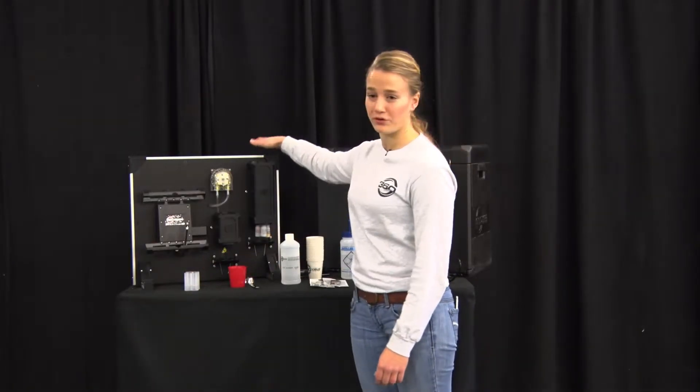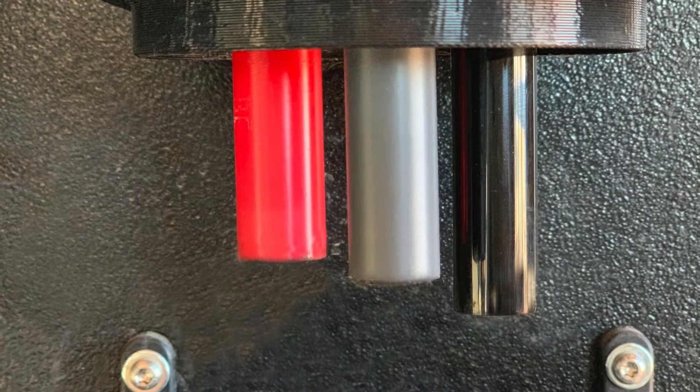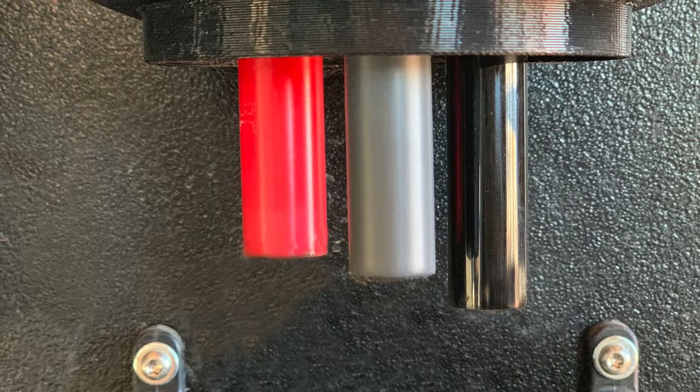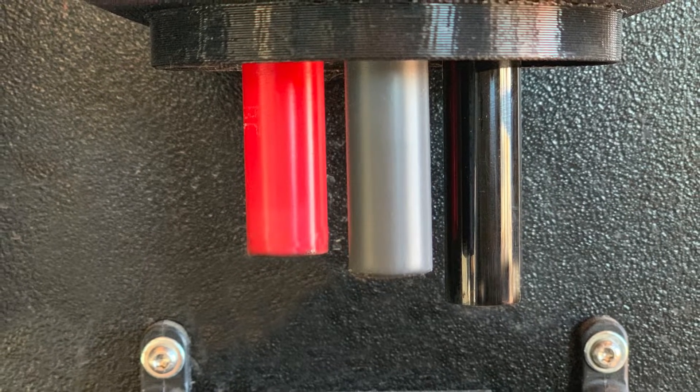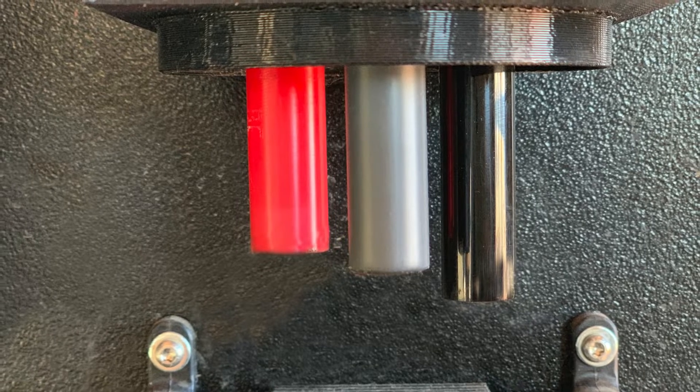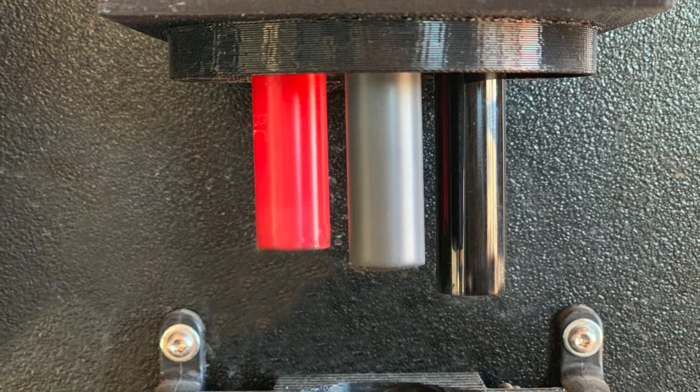Also your SoilScan base. Provided with the SoilScan kit will be a red reference sensor and a gray nitrate sensor. There is the optional pH sensor which is black. That would be an additional.